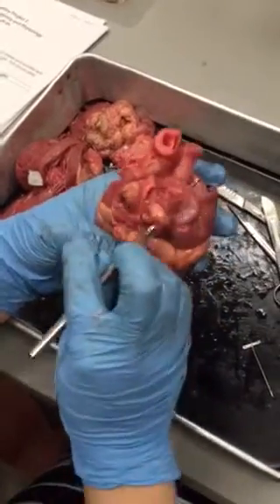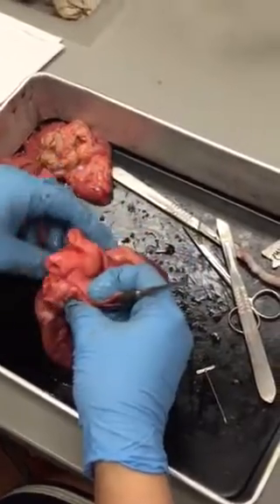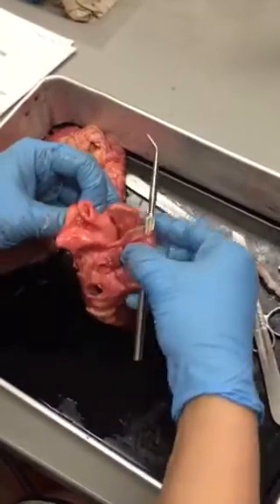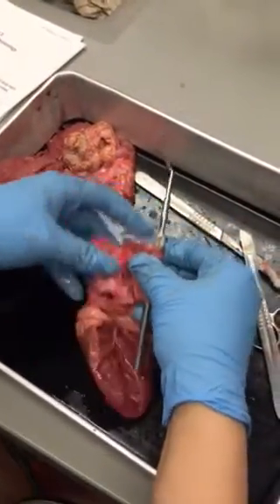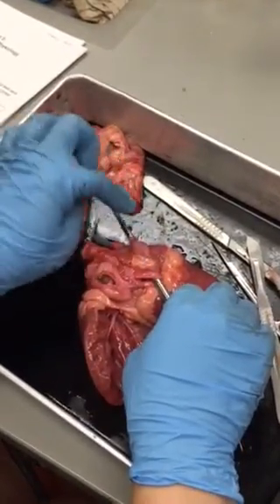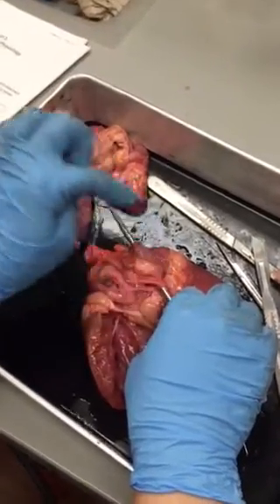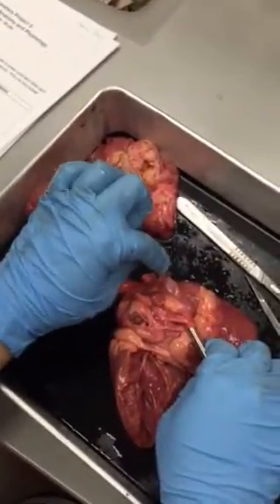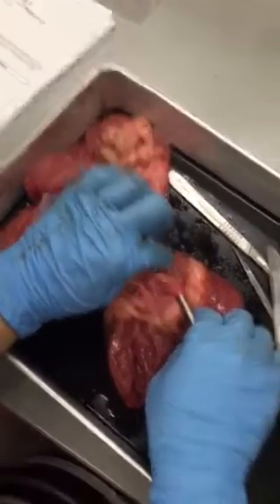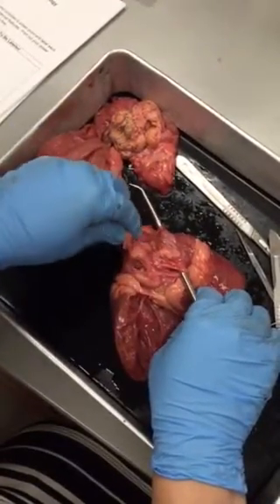Okay, so let's start here. Remember, this is the trunk, so this is the right side of the heart. This is going into the right atrium. Going into the right atrium, you have two vessels, and I've put this through both of them so that you can see that there's one that is superior and one that is inferior. So this is the superior vena cava, and this is the inferior vena cava, both going into this right atrium. Oh, that's where they are.